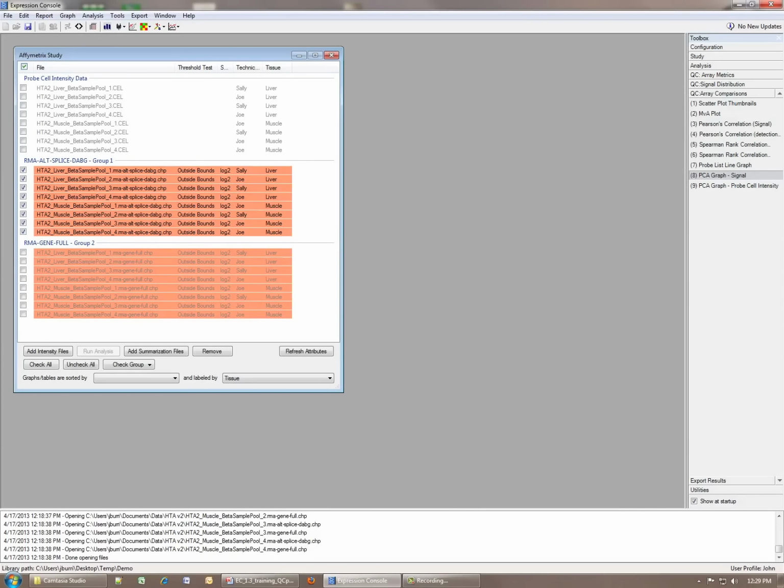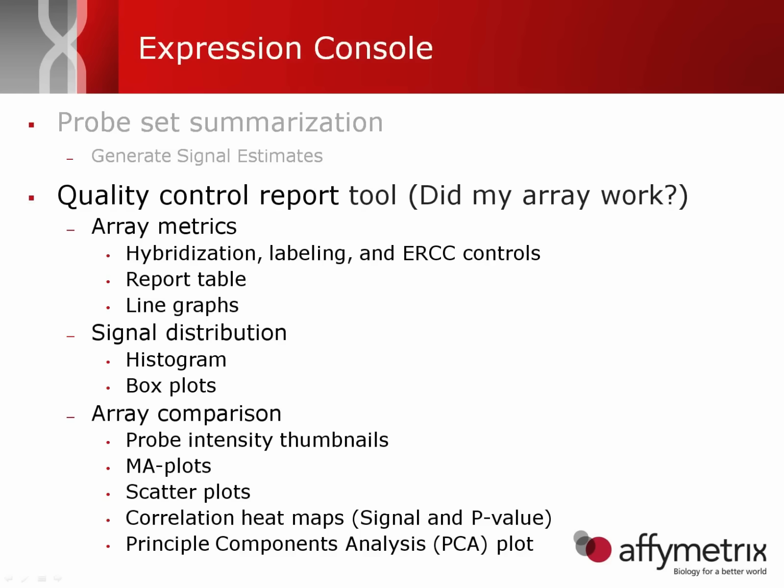In addition to the chip files that are produced, it's also possible to export a text version of the data. And so if you go to the export results, any of the open tables and graphs can be exported to a PDF to create a report. And you can dump out the signal summarization values either with or without annotation using these two buttons here. So that concludes the demonstration portion of the Expression Console piece.